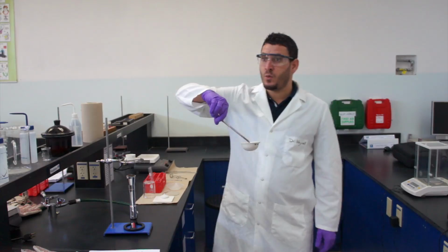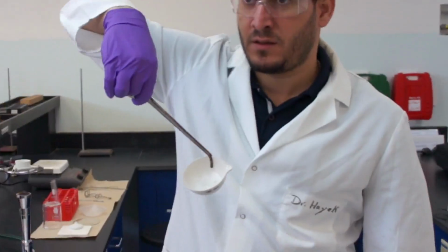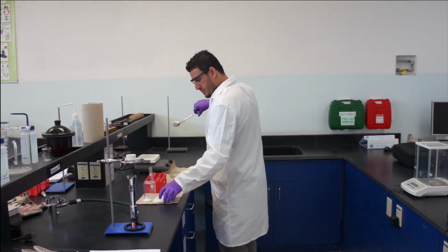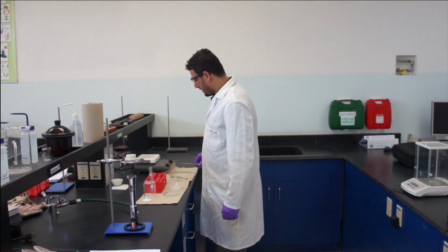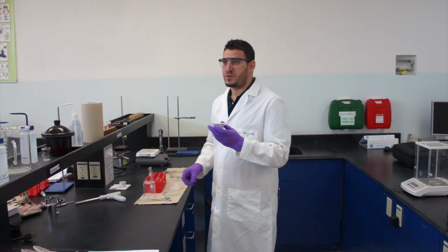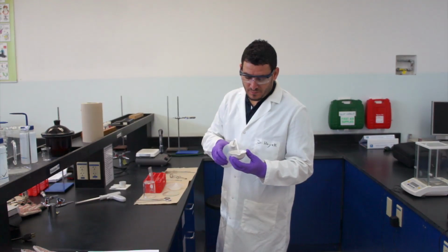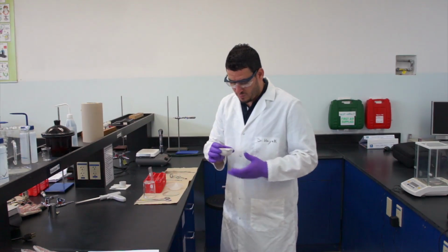So after the water evaporates, this is what we can see. You can see that I have white solid again. I will just leave it to cool down on this tile here, and I will deal with it after that. The dish returned to room temperature. What you have to do, guys, to the solid in the weighing dish, I will add water again, okay? Enough to dissolve the solid, do not add too much.